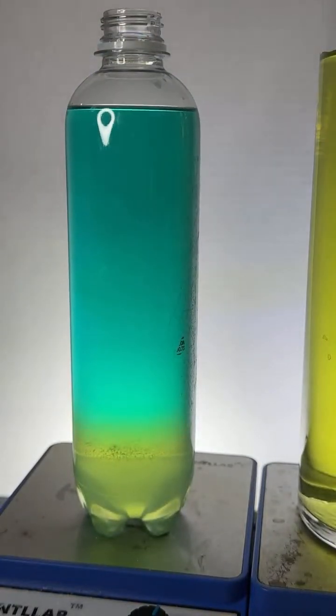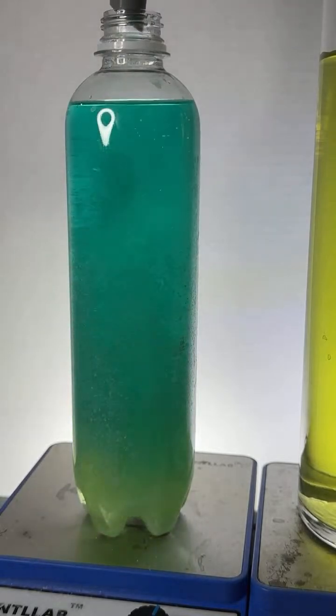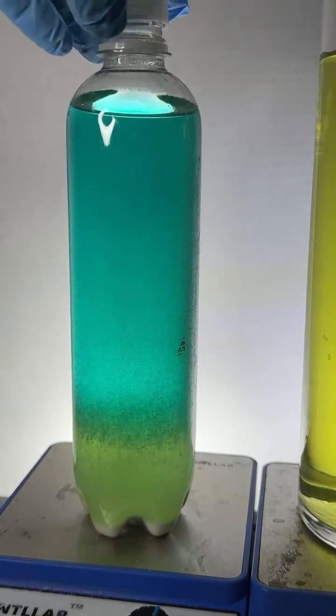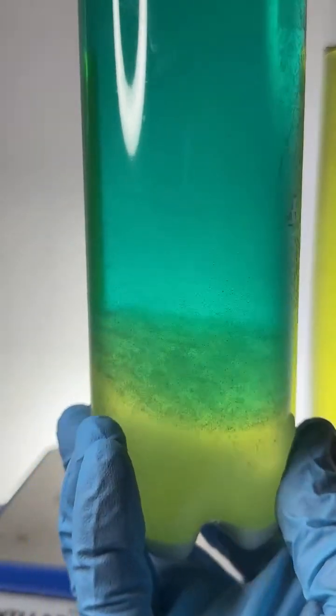It also has to do with the sizes of the molecules. The larger the size of the molecule, the tougher it is for it to dissolve in water. Because if you're a larger dye molecule, you have to push apart more water molecules, which is very energetically costly to do that. All right, let's see if this gets it.